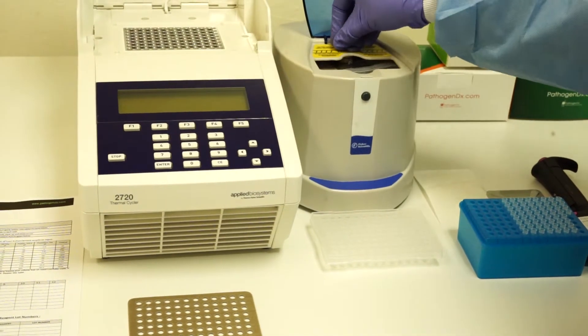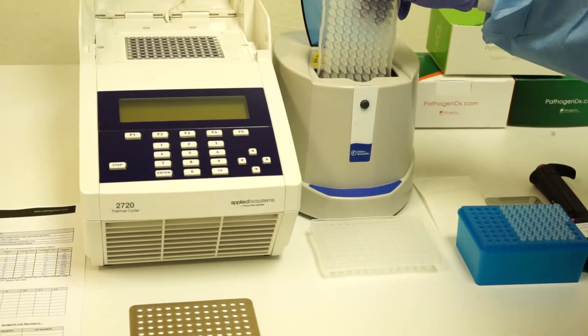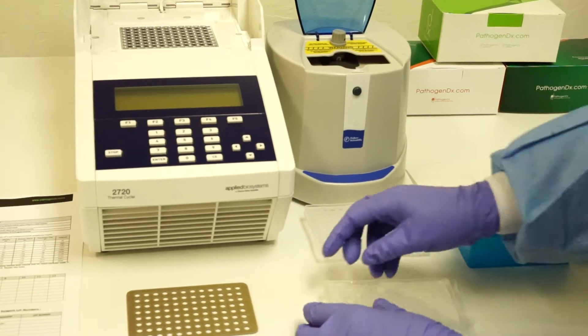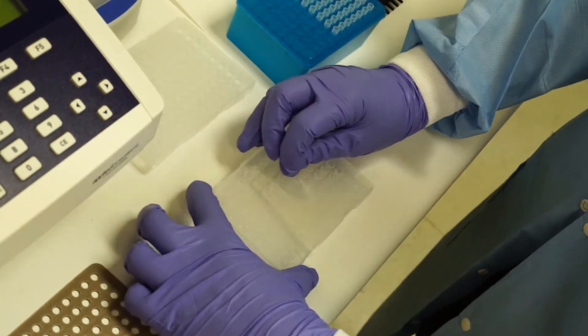Once the centrifugation is complete, remove your plate and carefully peel back the seal to avoid contaminating any of the wells.